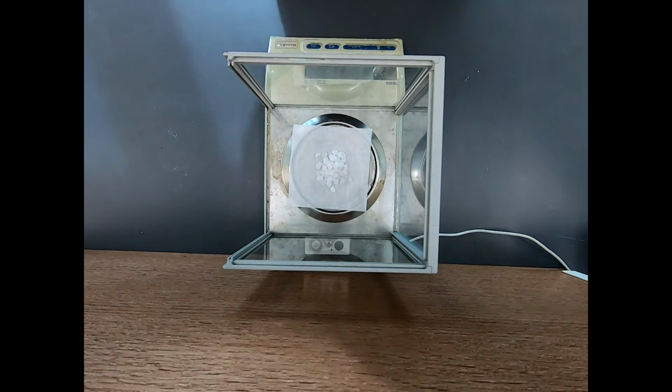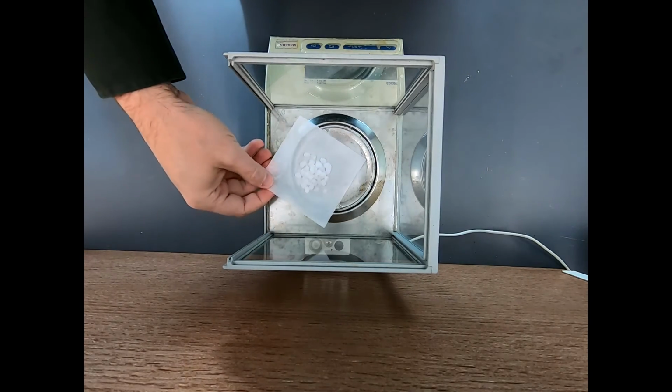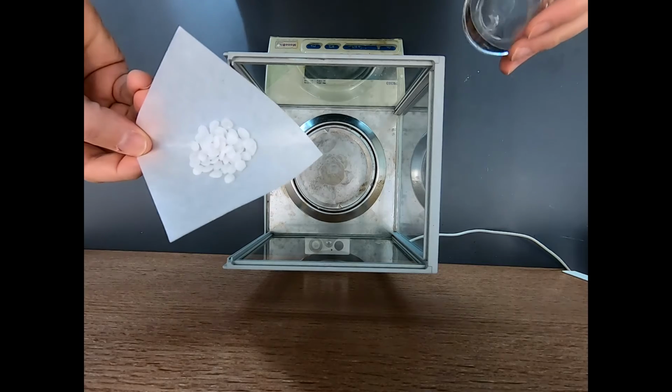Now I'm going to go ahead and keep that, but that is more than I intended. About 5.1 was what I was aiming for, but that's okay. Remember, KOH is a pretty strong base, so we don't want to handle this with our hands or anything. And we don't want to leave it on the bench because it will absorb moisture and ultimately CO2 from the air.